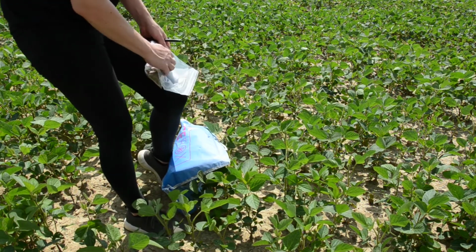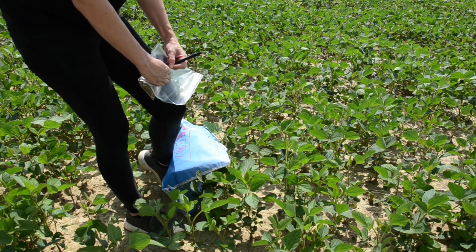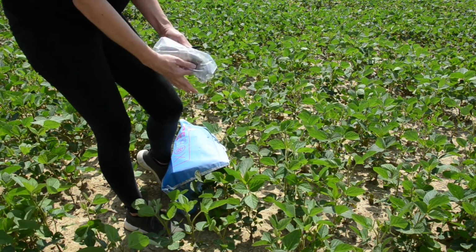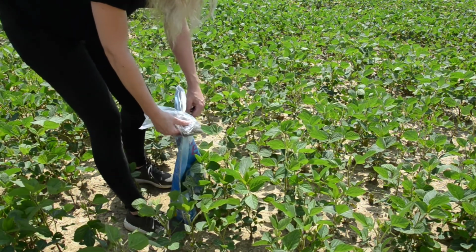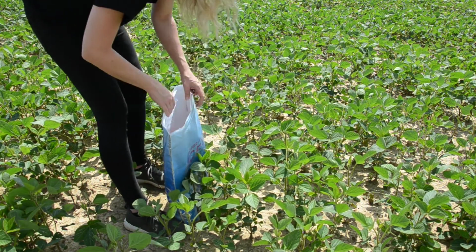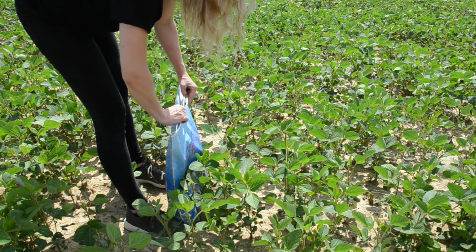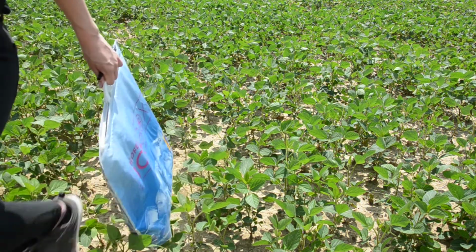Write the sample ID on the plastic bag with the waterproof pen. This is especially important if you have several samples. Keep the samples in your cool box over the whole sampling time. The values can change significantly in a short period of time, especially on warm days. The samples must be prepared within 1 hour, or the next day if they are kept in the freezer.